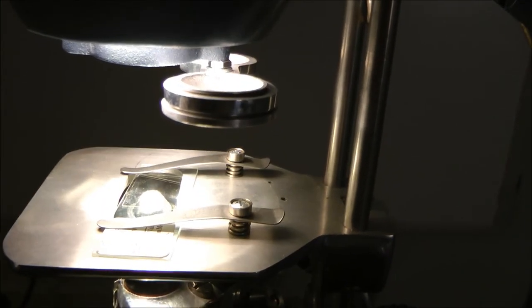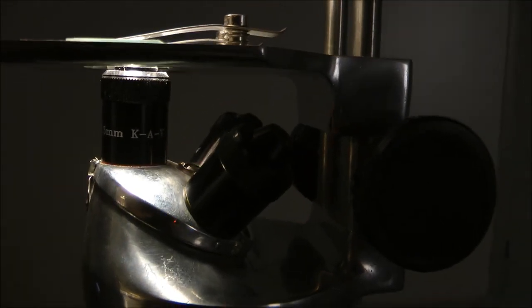To gain an additional five times magnification, rotate the revolving dust proof disc until the red A is present.